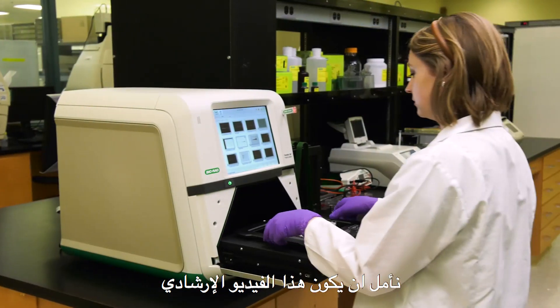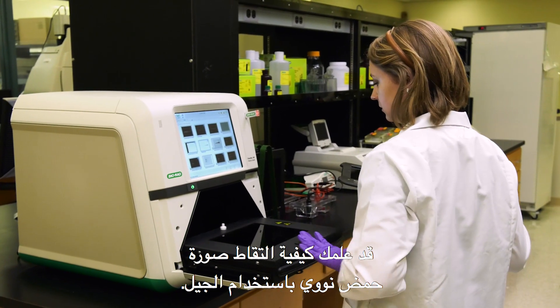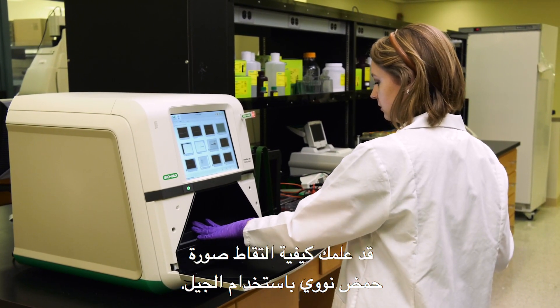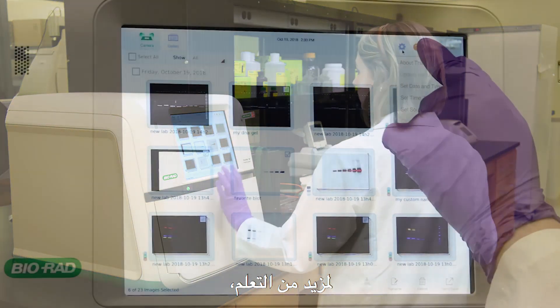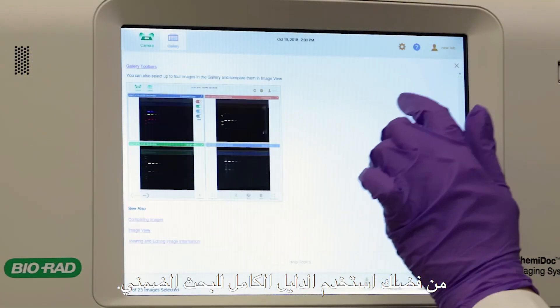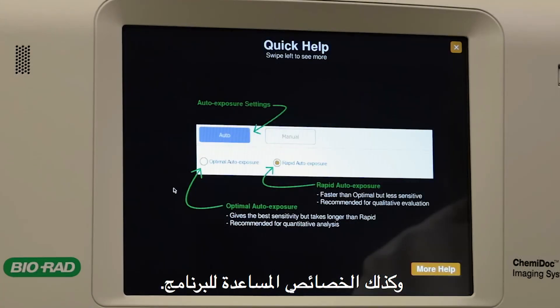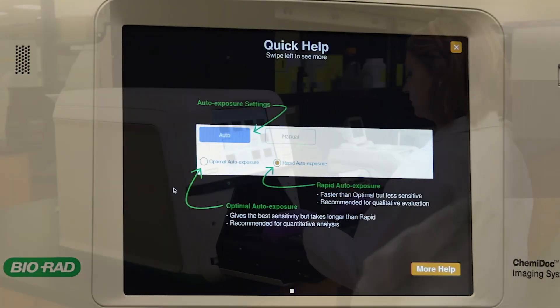We hope that this instructional video has taught you how to capture a nucleic acid gel image. For further learning, please utilize the complete, searchable onboard manual, as well as the Teach As You Tap software assistant feature.